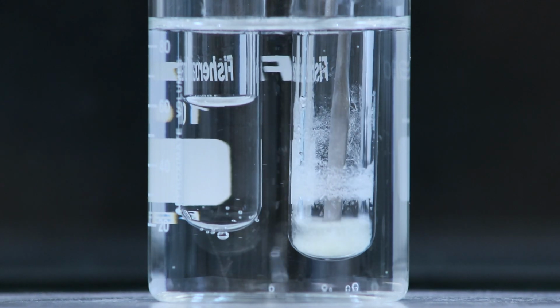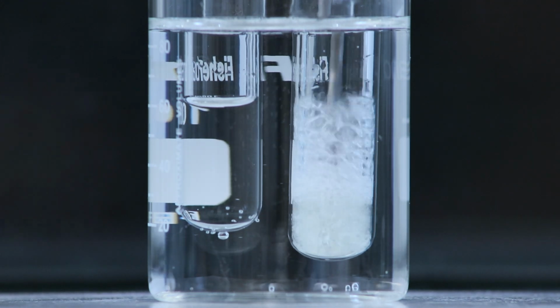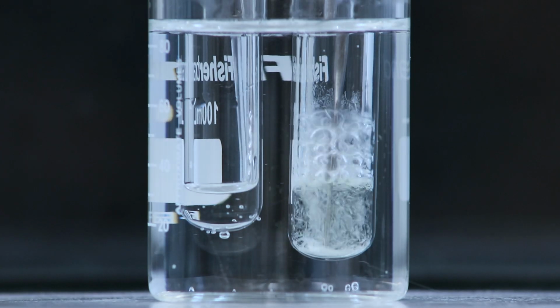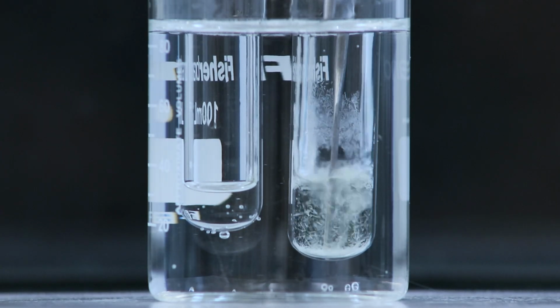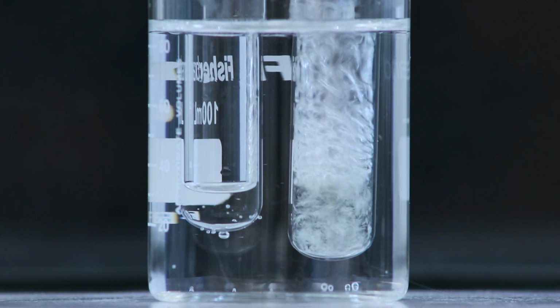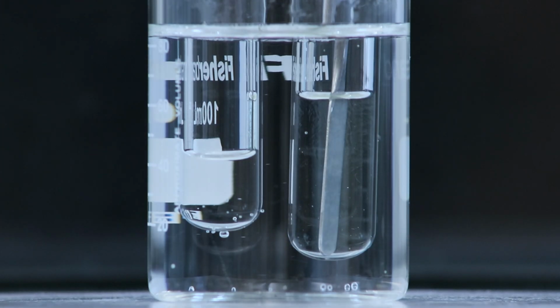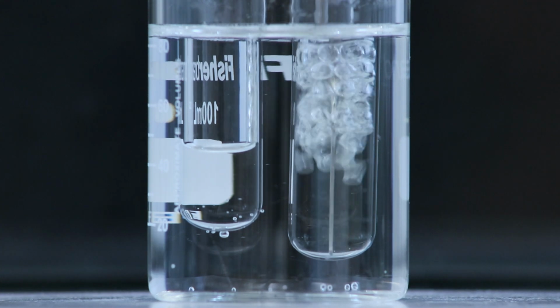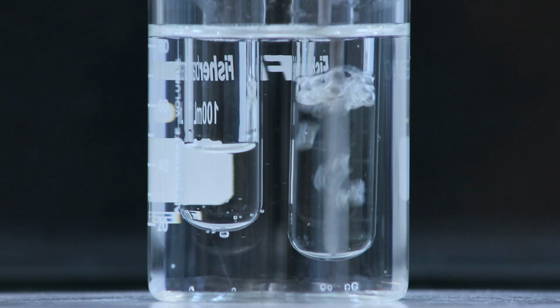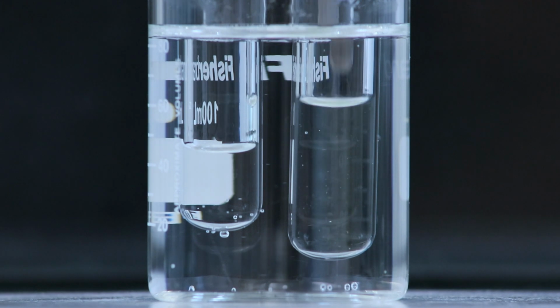And there's not going to be a specific amount for every single lab because that'll depend on how much solid you had, how soluble that product is in the solvent, plus it could also depend on what temperature you have the hot water bath at. So you should continue to add the solvent in small increments while stirring the solution just up until the product is fully dissolved in that solution. And each time before adding more solvent, you should stir the solution really well to allow the solid to dissolve as much as possible, and if it's not fully dissolved at that point, then you can add more solvent.